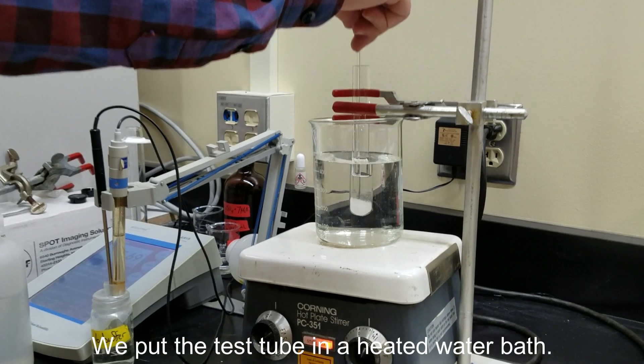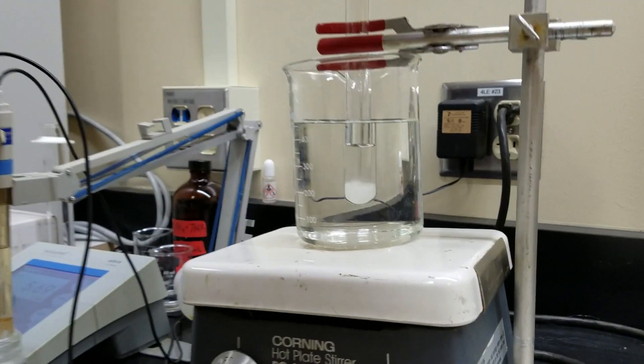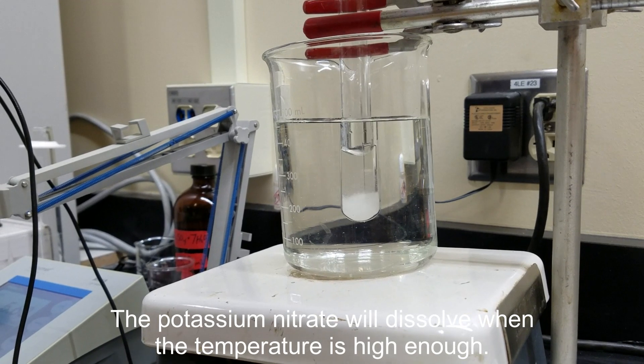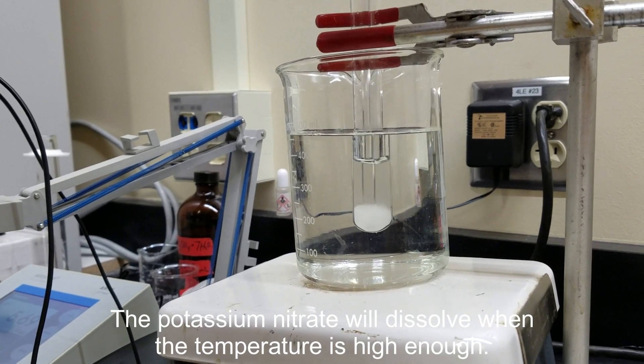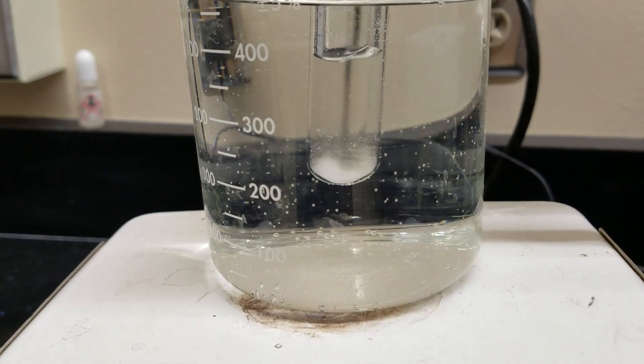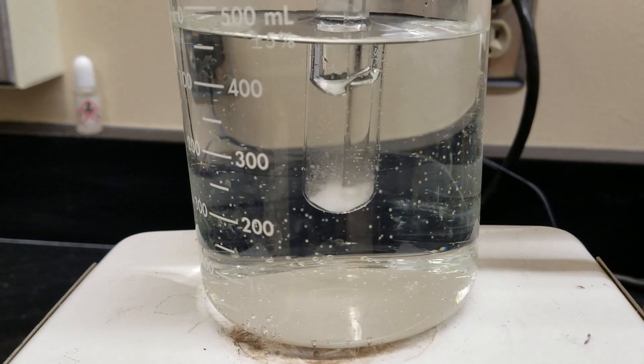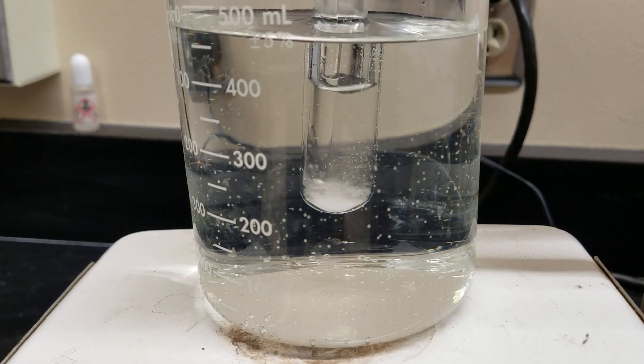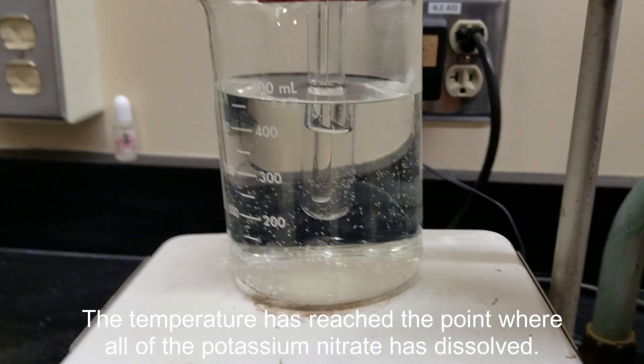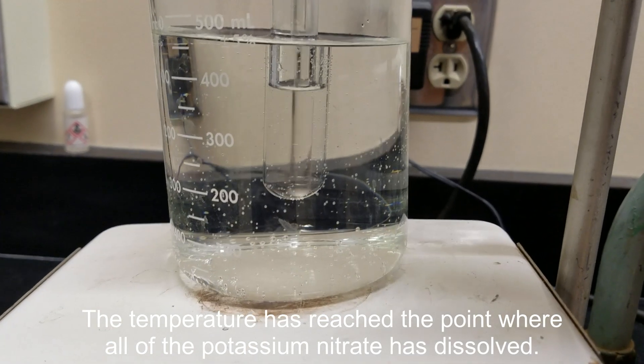But we'll start heating our solution in a water bath. Take a look at what happens to the potassium nitrate. As the water gets hot enough our potassium nitrate all goes into solution. We heat it a little further and all the potassium nitrate has now gone into solution.